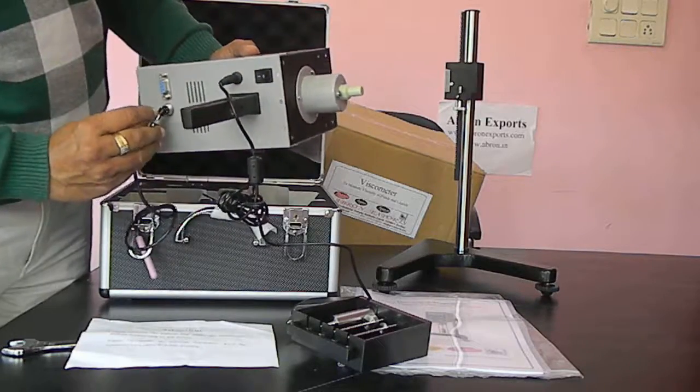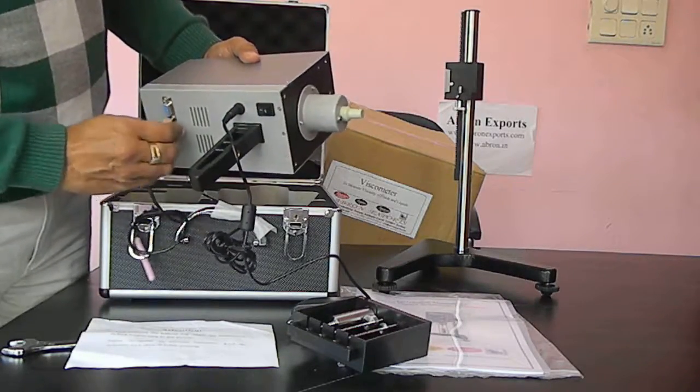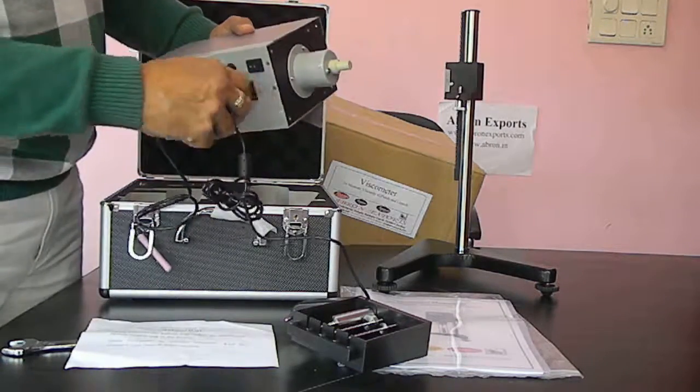This slit is there so that it goes properly inside. Then secure the lock. You can connect the lock. You can take a printer output like this.